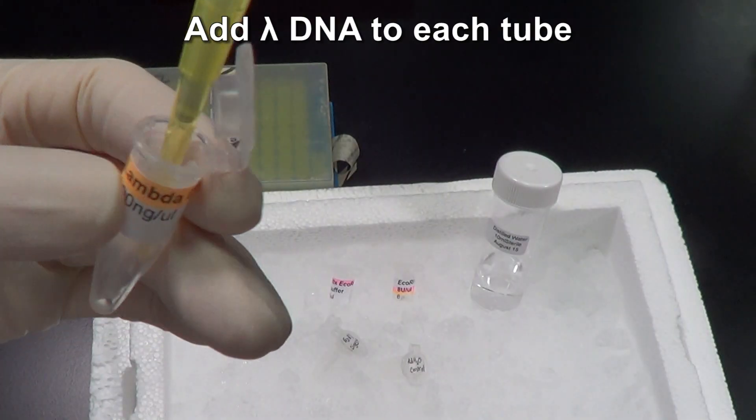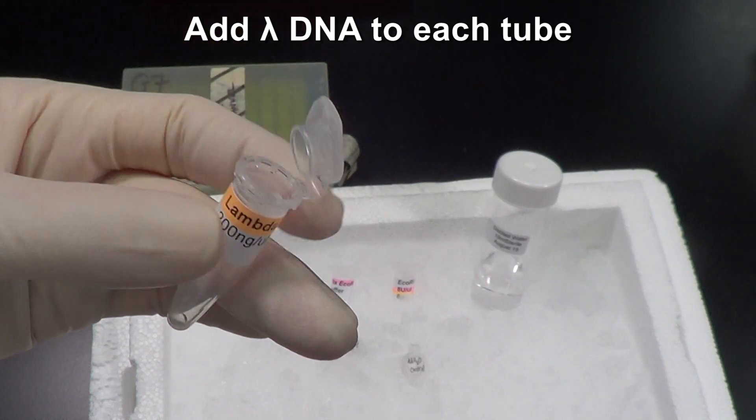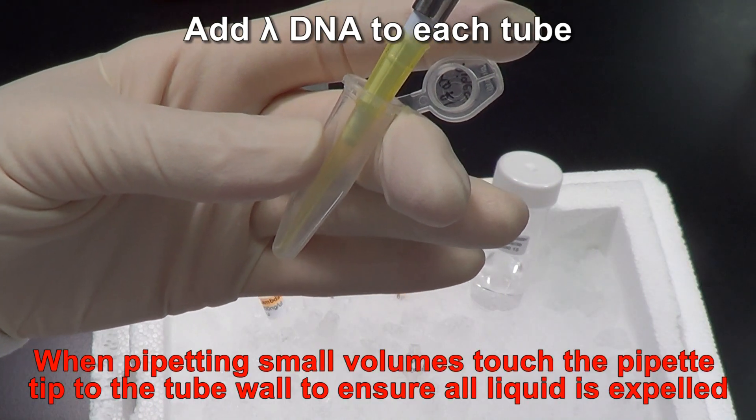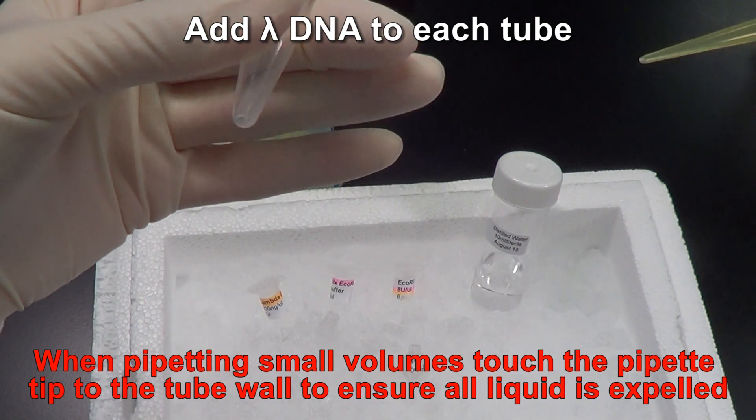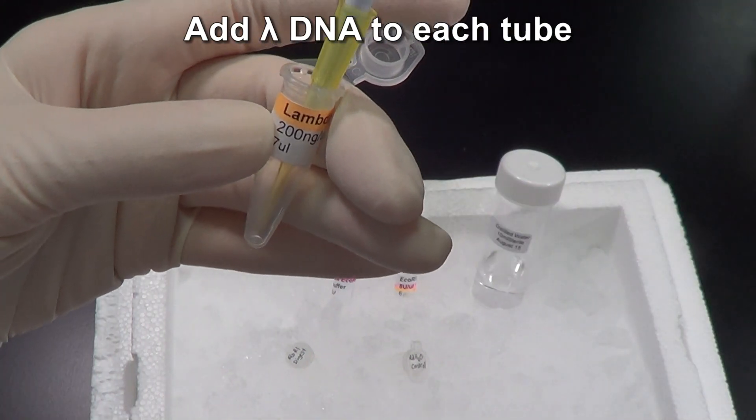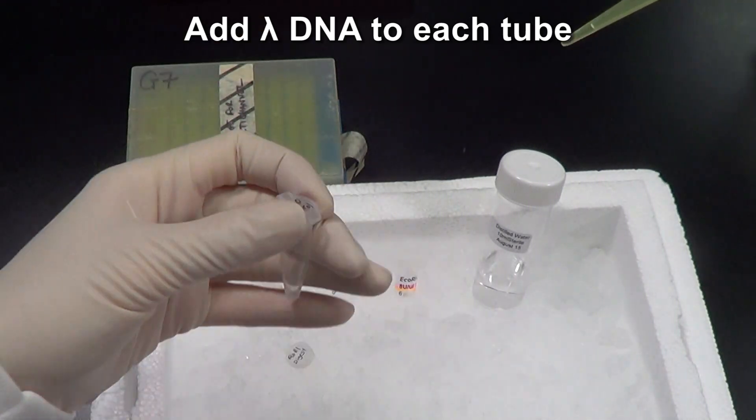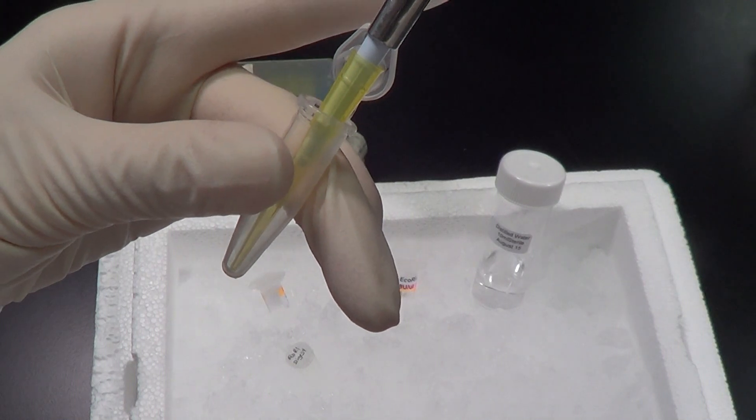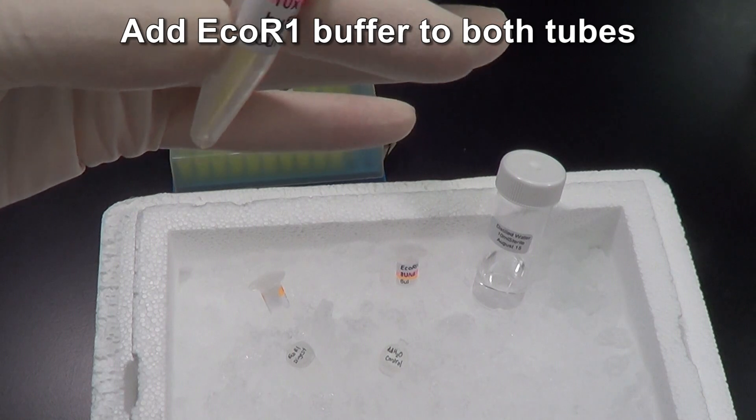Add lambda DNA to each tube. Always change tips between tubes. Add EcoR1 buffer to both tubes.